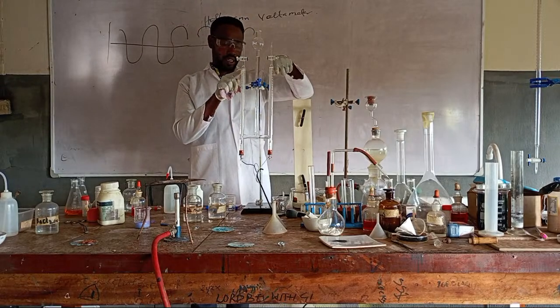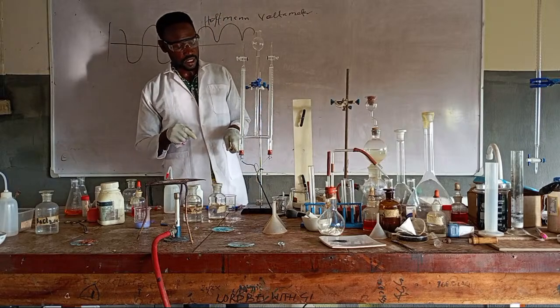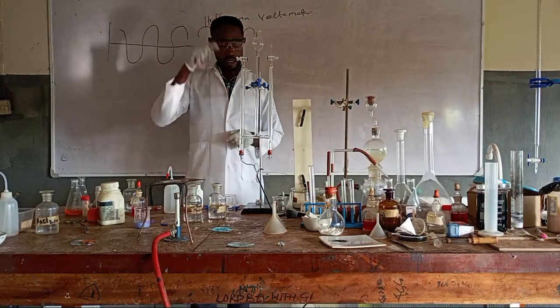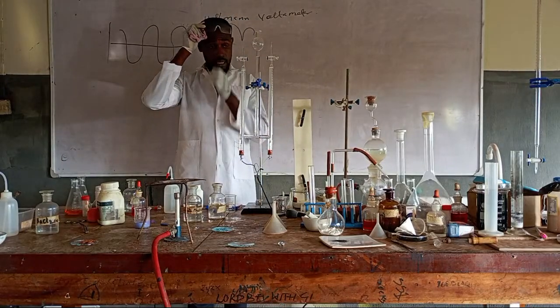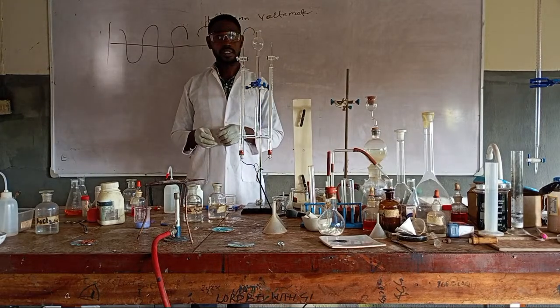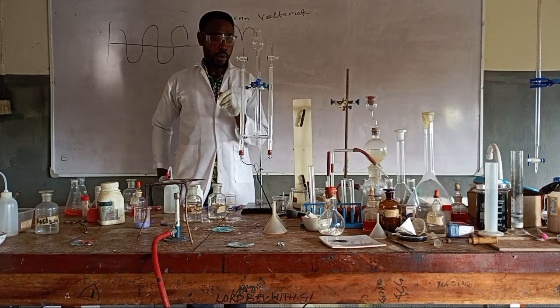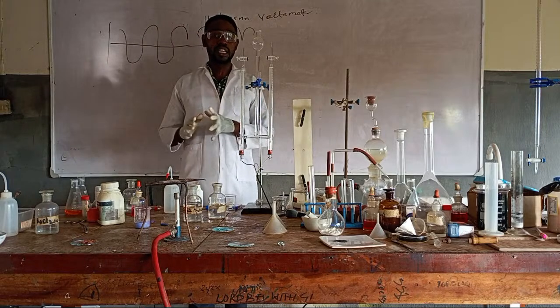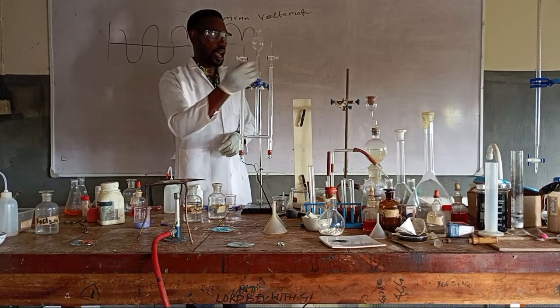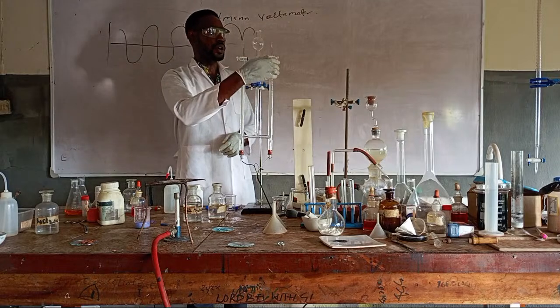Are you saying that this one is the one that is liberating hydrogen automatically? This is our cathode, while this is our anode. But I might increase it so that it will give us the gas, because we'll collect the gas and test it. Hydrogen burns with a pop sound, it's very explosive, while oxygen rekindles a glowing splint. But remember that water always contains hydrogen and oxygen in the ratio of what? 2:1. Are you seeing it now? If you read this, it is always ×2 of what is here.